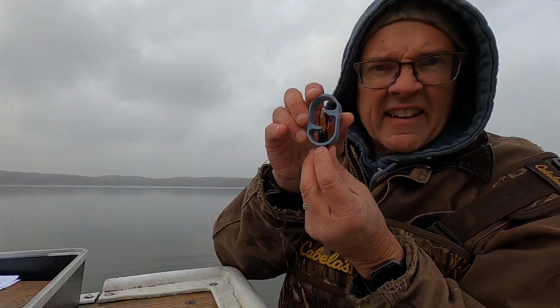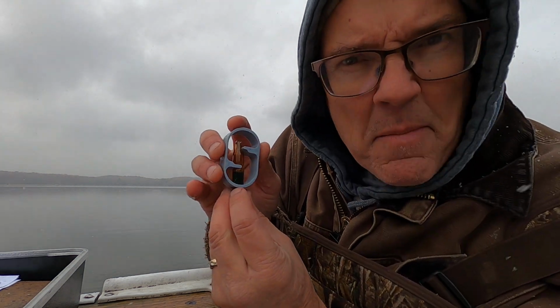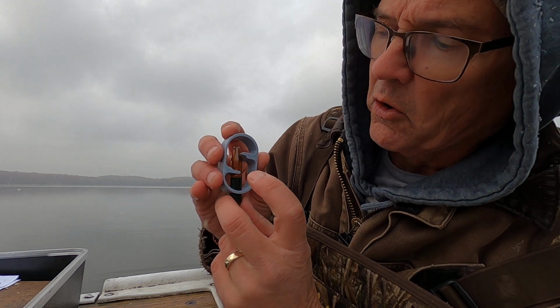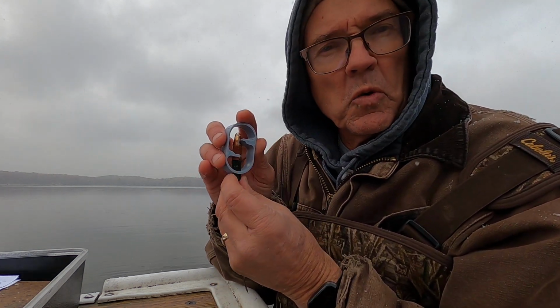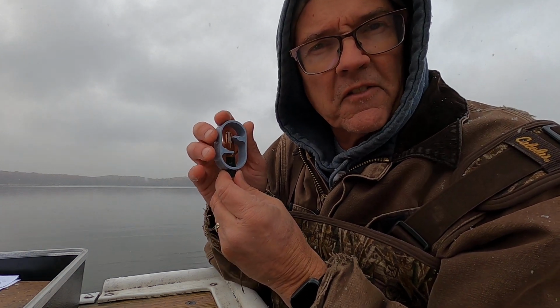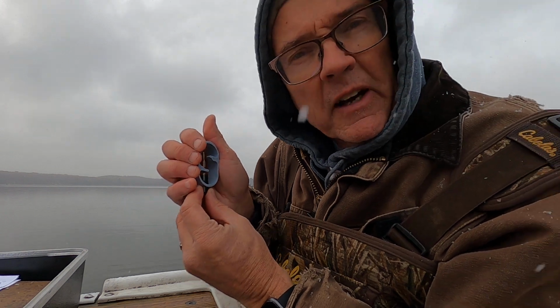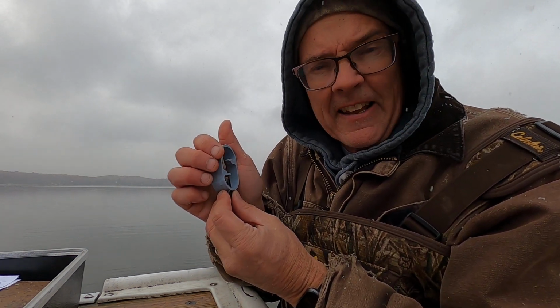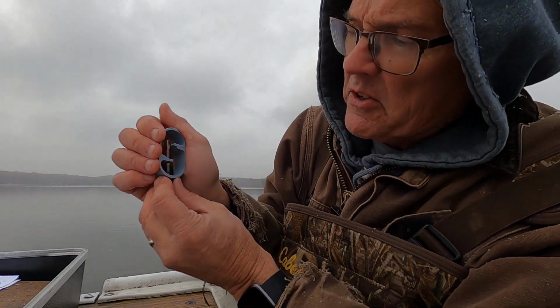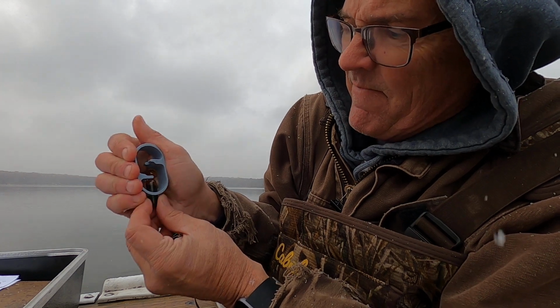This is a little glass ampule with the bacteria growth media that'll turn different colors depending on who pooped it, whether it's human poop or fish poop or crayfish poop, whatever. So I would hope that we'd have wildlife poop in the lake because we'd want fish and things in the lake. I'd also hope that we don't have human poop. So like, this blue container breaks the glass. Okay.